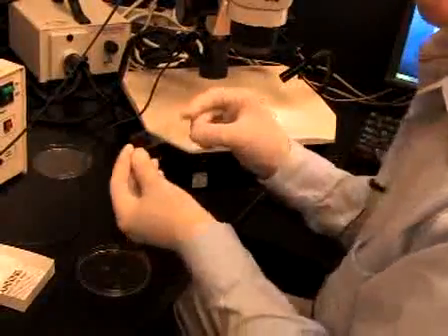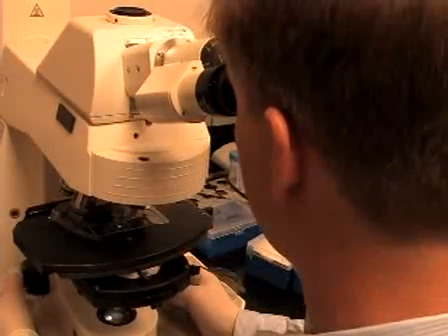Okay, and we're ready to look at that under the microscope. Yeah, that looks really good.